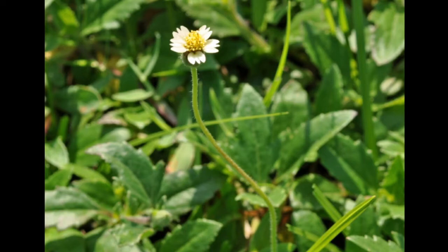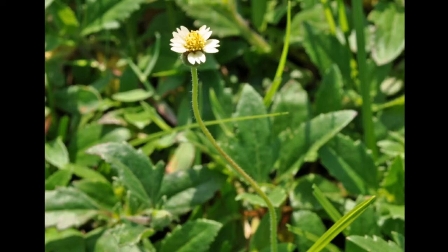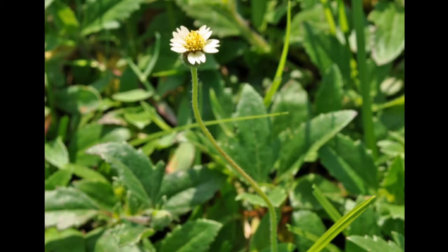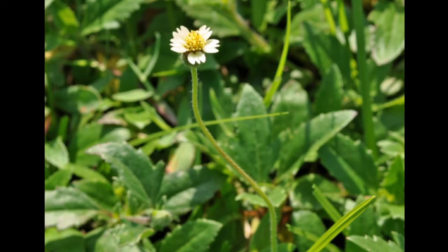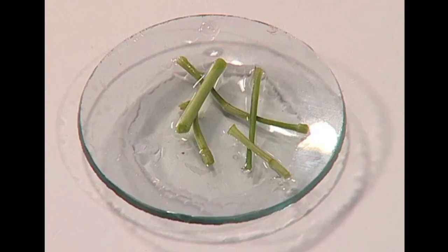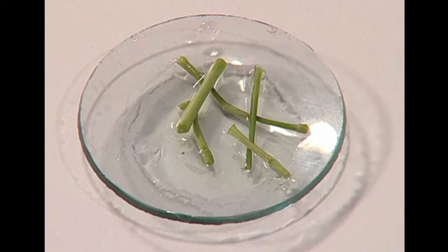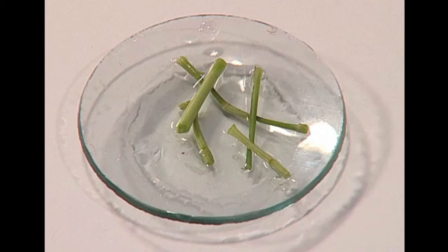Before taking the TS of any stem, first remove all the leaves from the stem. Collect a stem that is soft enough to take the TS, then cut two to three centimeters length of stem and carefully place them in the watch glass. Now we need to cut the stem into thin slices so that they will be transparent and allow us to see the cells and tissues clearly under the microscope.